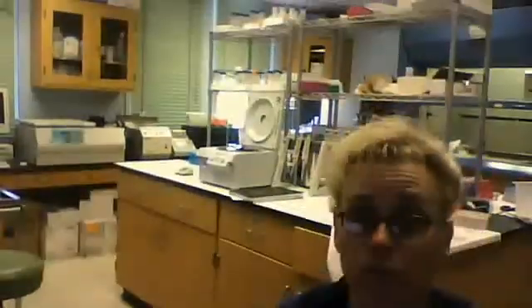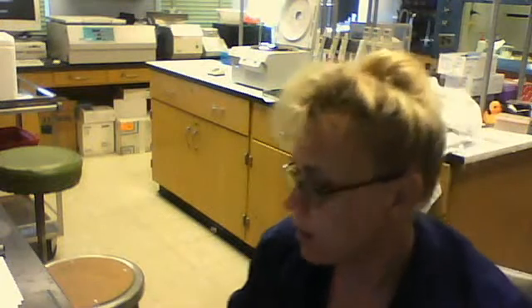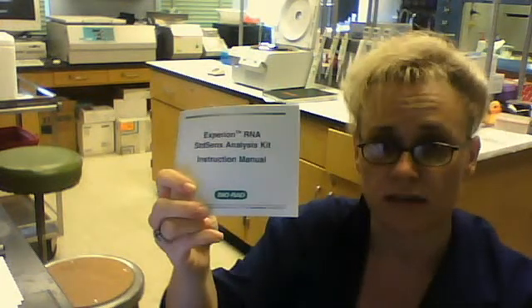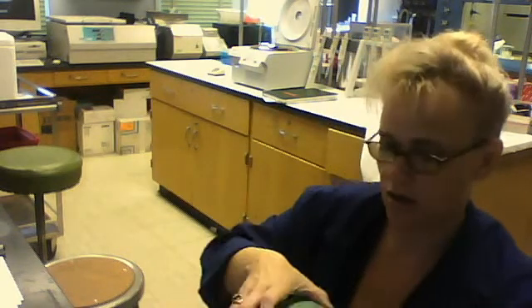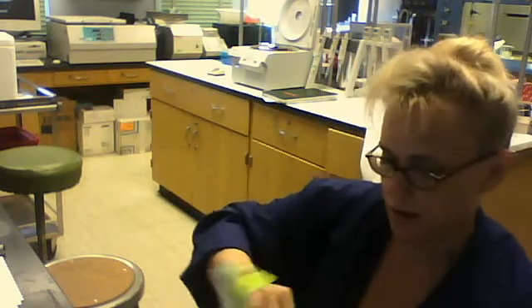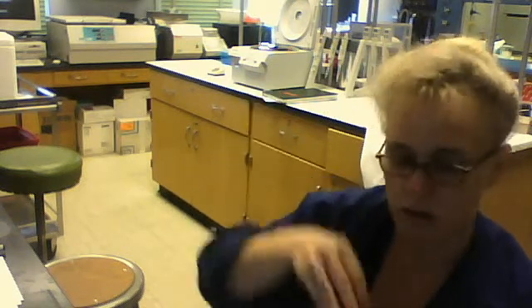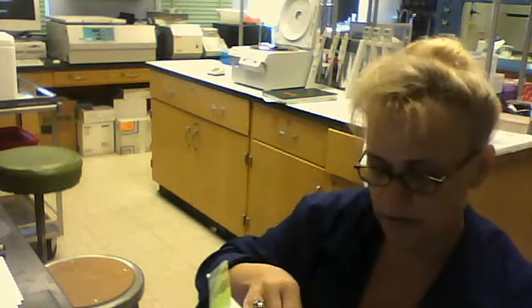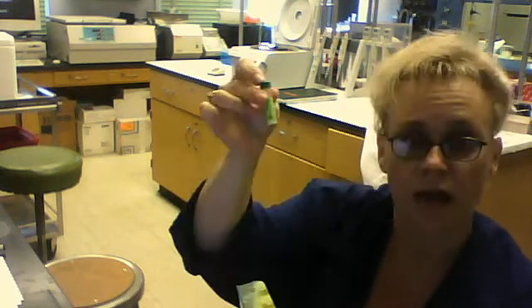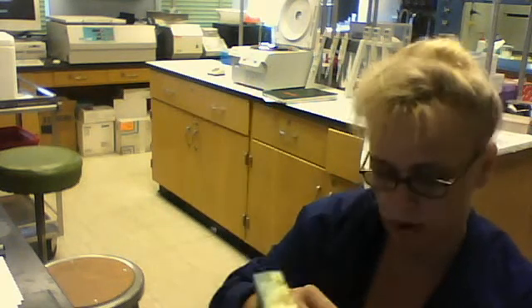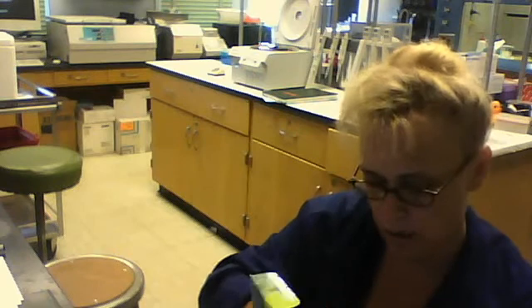The second part of your process is I would actually go to the computer and put your samples into the computer. And then it comes with a kit. The kit looks like this. This is the manual. This is the kit. The kit is going to have units in it that have a yellow top, a green top, and a blue top.